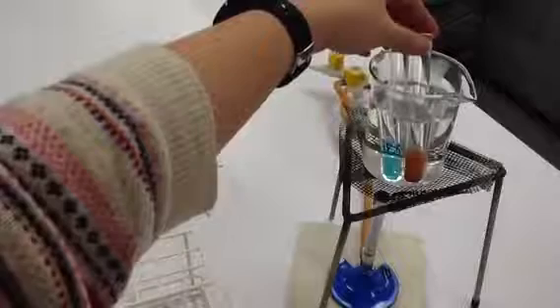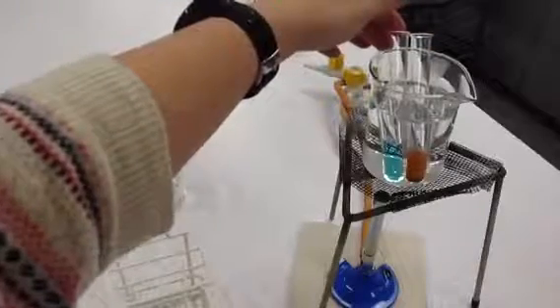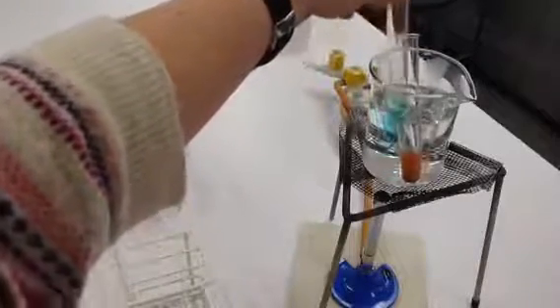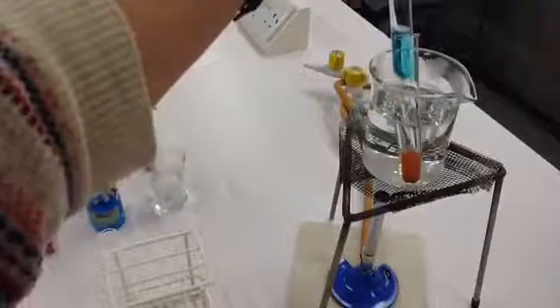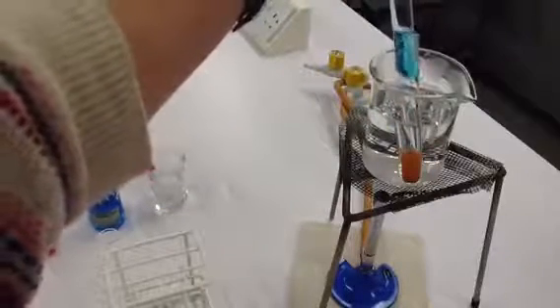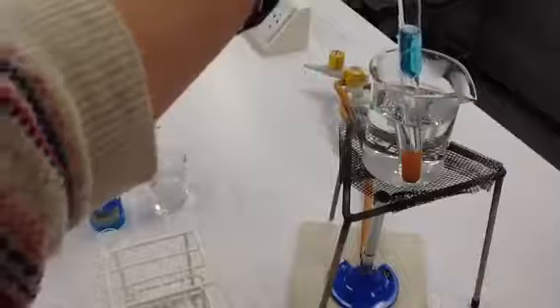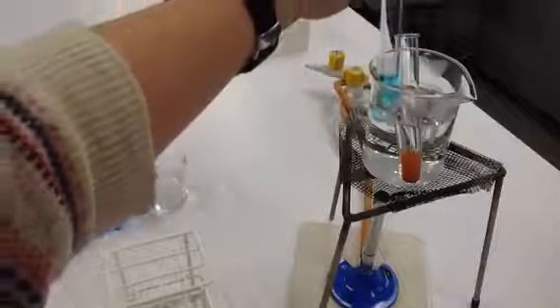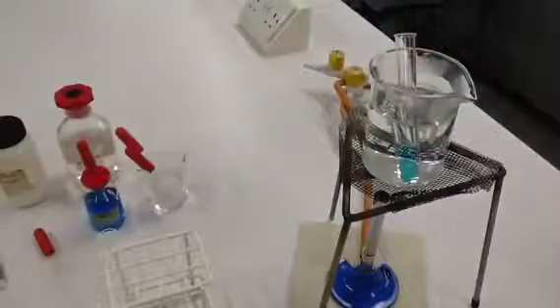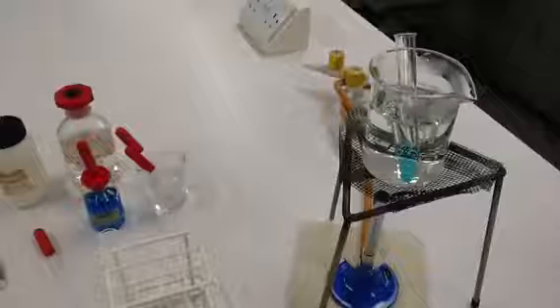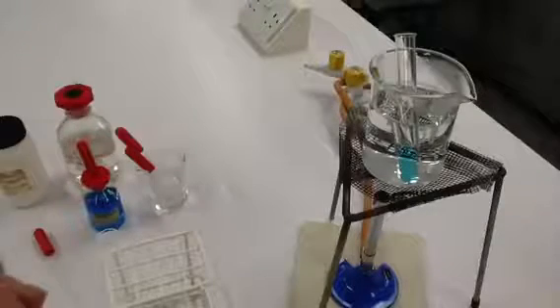So this is the result of testing two samples, A and B, with the reducing sugar test. We saw that sample B gave us a negative result. It remained blue, indicating that sample B is not a reducing sugar. If we take sample A away, we know that's a reducing sugar because it turned orange, so we don't need to go any further with that sample.